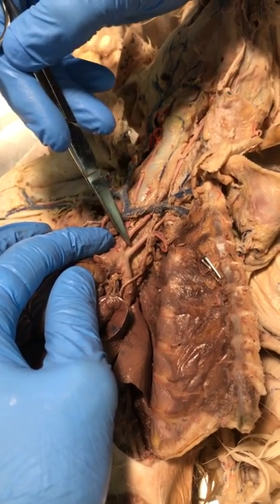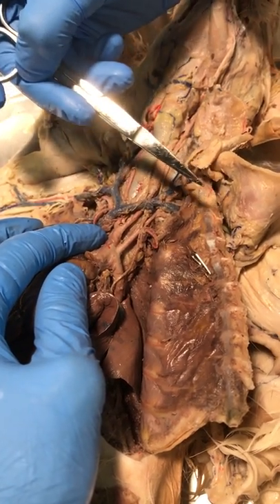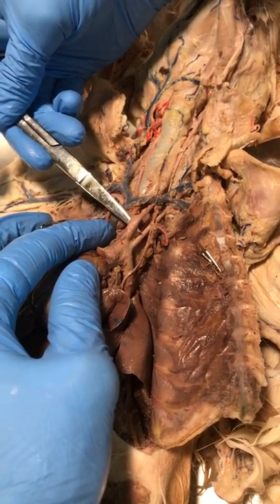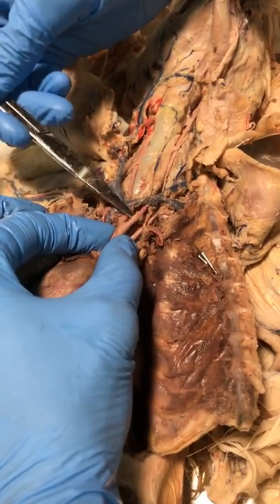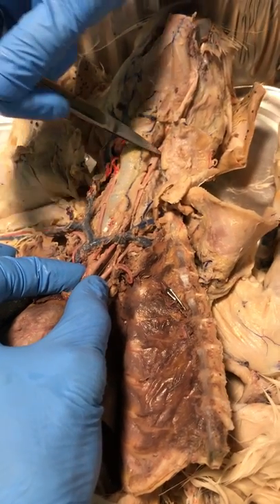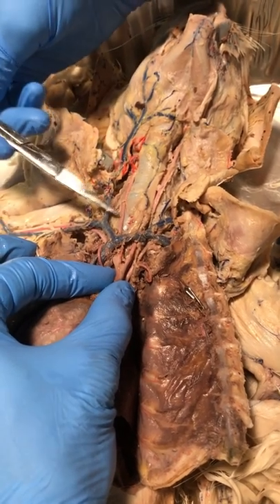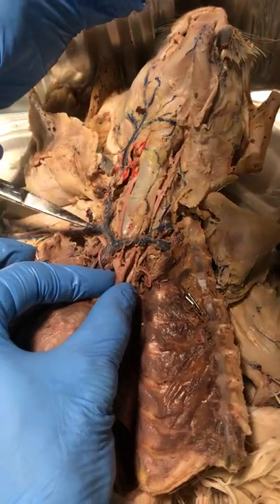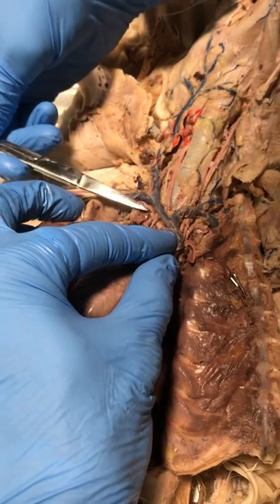The aortic arch on cats has two branches, unlike humans which have three. One, two. The left branch is the left subclavian artery that will continue into the arm. The right branch is the brachiocephalic artery and it's going to have three branches off of it: the left carotid artery, which will continue up the trachea and into the brain. Here it is. The right carotid artery that will continue up the right side of the trachea and into the brain and face. Here is the third branch, the right subclavian.